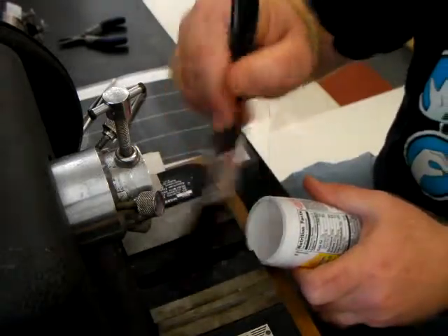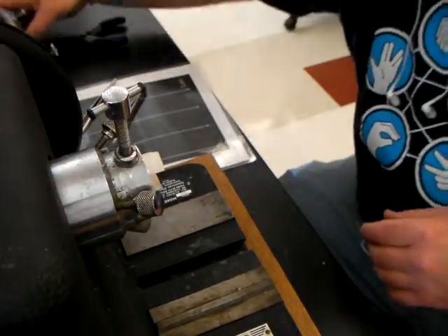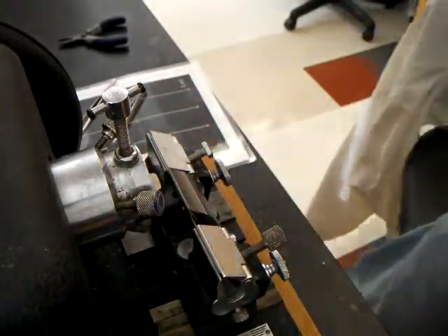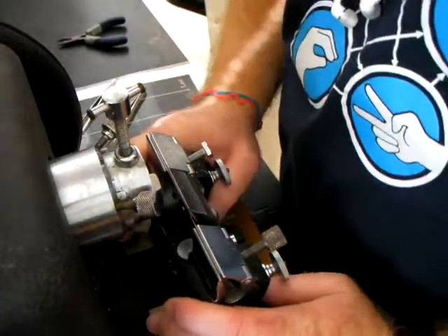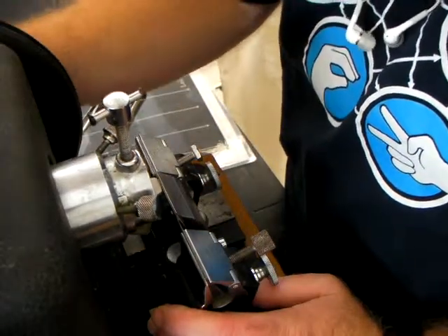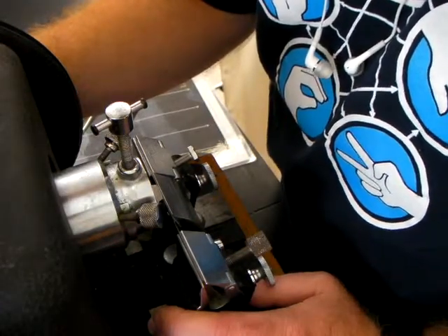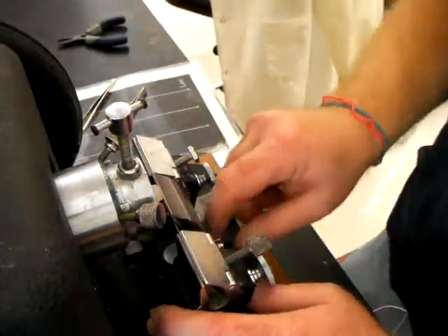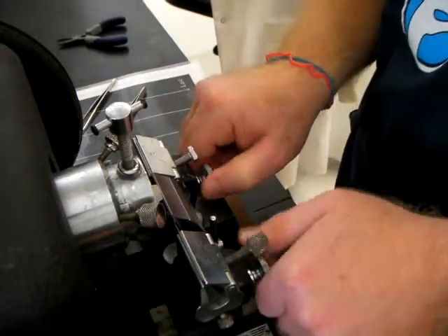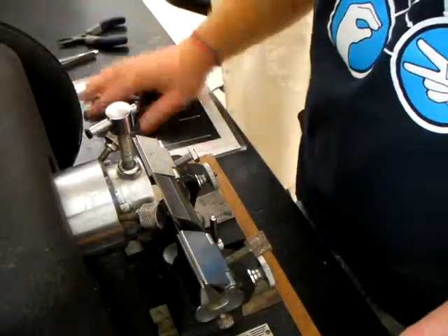Clear away any excess paraffin and get it out of the track where the blade holder goes. Now, with the specimen locked in place, return the blade holder to the microtome. Push the blade in, loosening the specimen to roll it down, until the blade is very nearly but not in contact with the specimen. Lock the blade holder securely in place and make sure everything is tightened down as much as it can be — this is absolutely essential for proper sectioning.